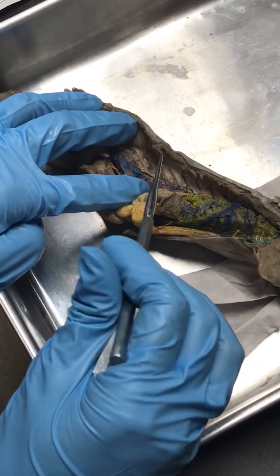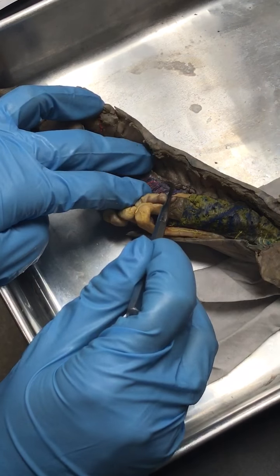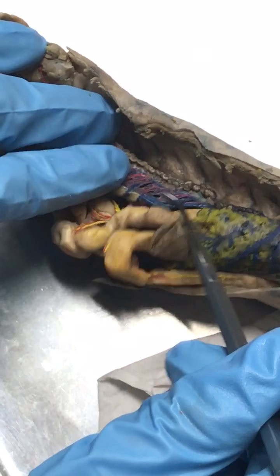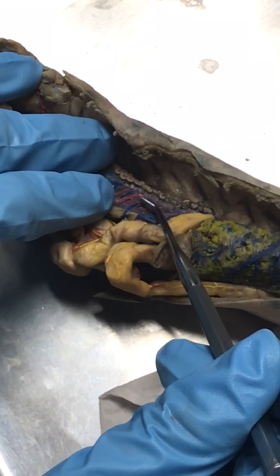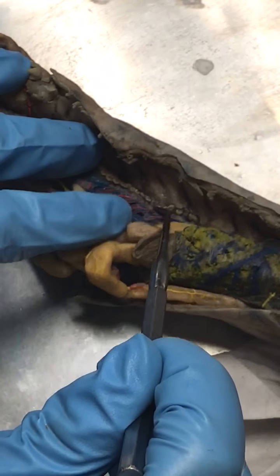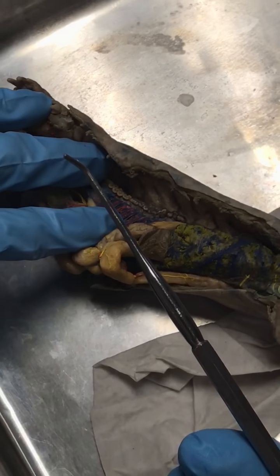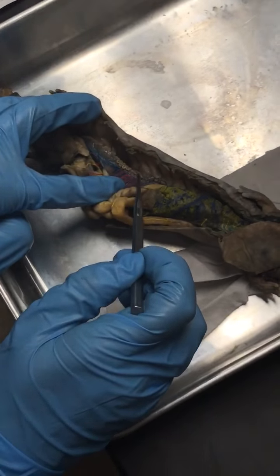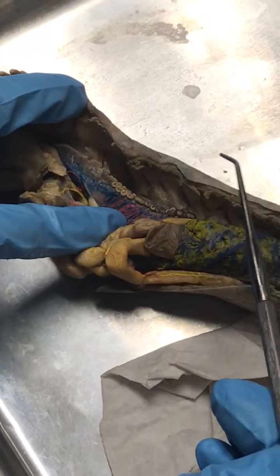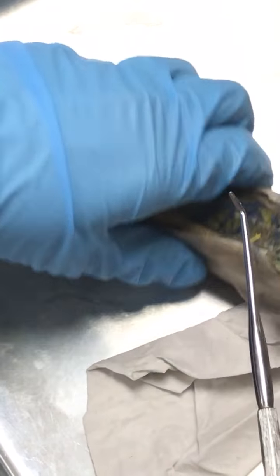The epididymis is the cranial part of the kidney. So the kidney gets really skinny, but you can see the gray tissue continue, and you can see all these vessels from the testes going in and out of it, and then it's next to the ductus deferens. So that's the epididymis, the skinny part of the kidney. And then it's cranial to the kidney. Okay, that's it for the male.